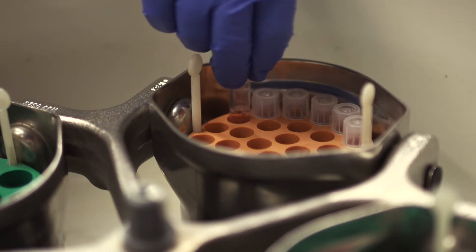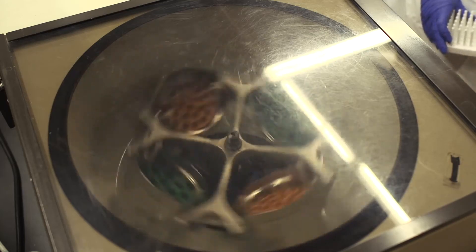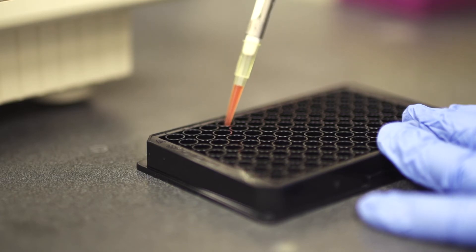After incubation, remove the media and wash the cells with the wash buffer. At this point, you can choose to label with additional stains or fix or embed your cells.